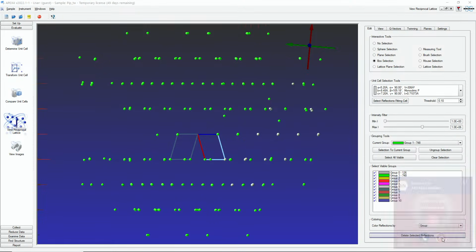That's interesting. I thought I turned that off. So we will display this by domain. And now the software will just highlight them in the domain with the green cell and the gray cell.